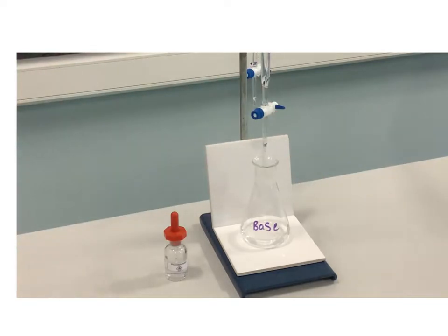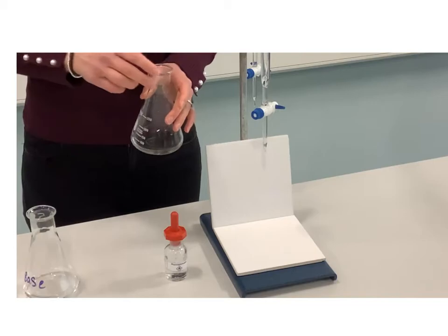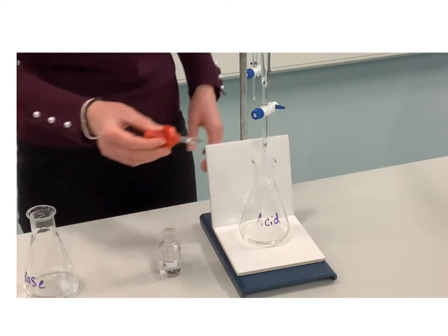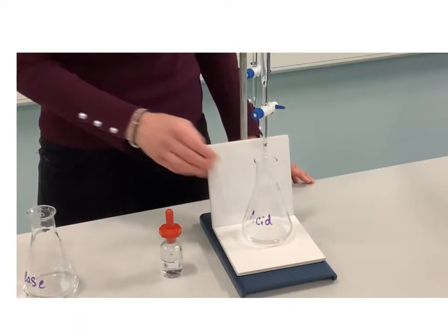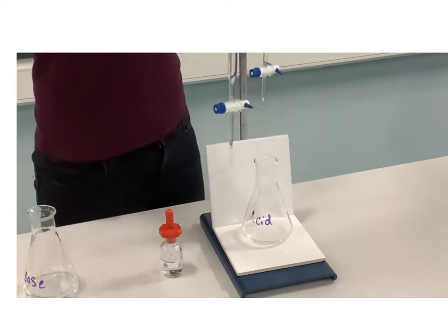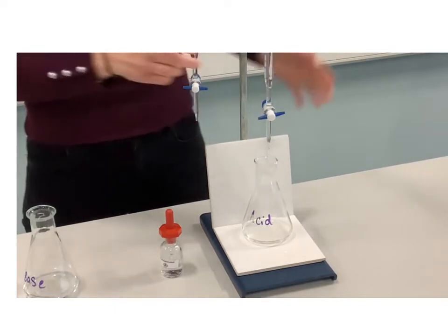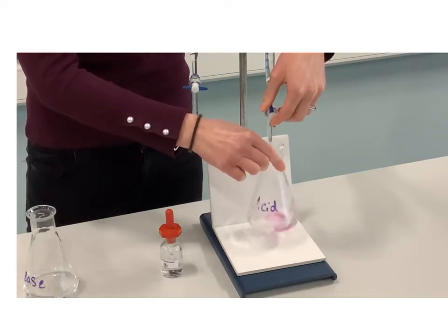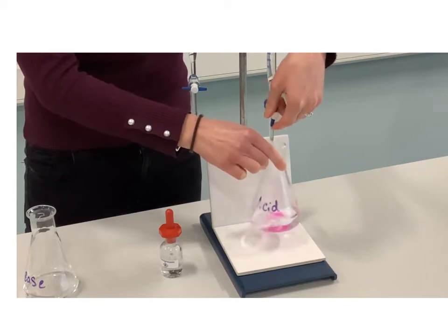What if we do it the other way around — acid in my conical flask? If I add a few drops of phenolphthalein indicator to the conical flask this time, you can see there's no color change; my solution remains colorless. So this time I want to add base to it, so I'm going to rotate my burette clamp so that the base is over the conical flask — I'm now adding sodium hydroxide to the hydrochloric acid. If you look closely you can probably see a bit of color, but when I swirl it that color disappears.